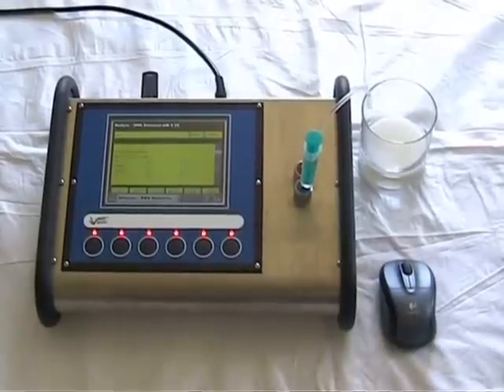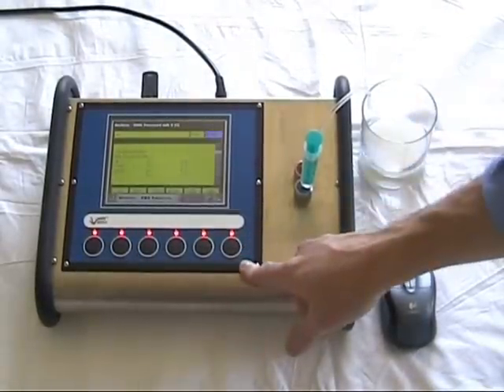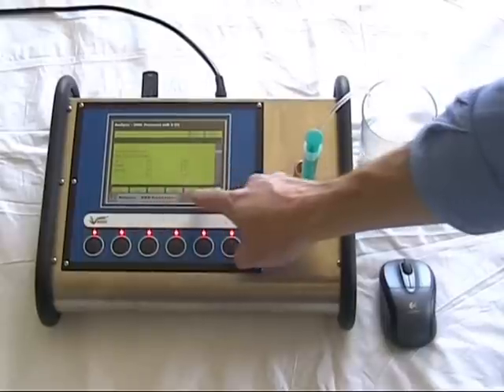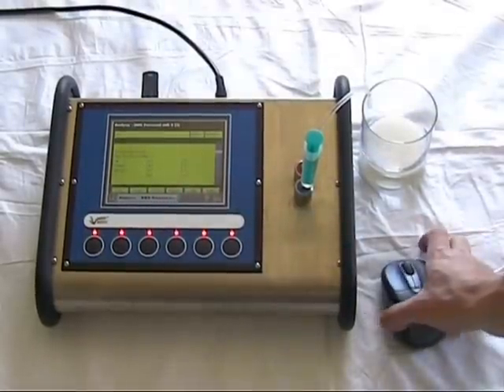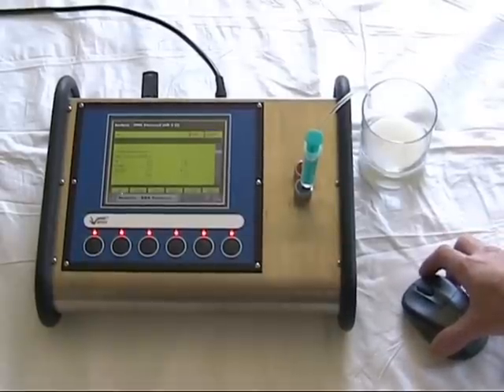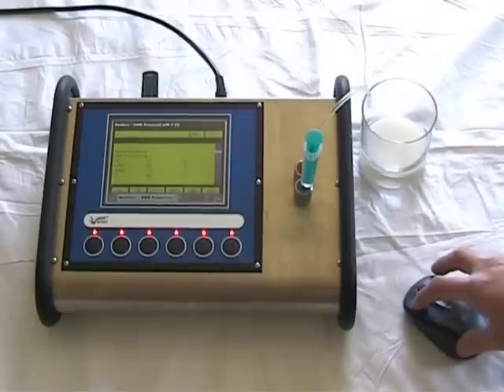Control of the instrument is by means of the buttons at the front of the instrument, which relate to the on-screen buttons, or by use of the wireless mouse. One can click the buttons on the screen.